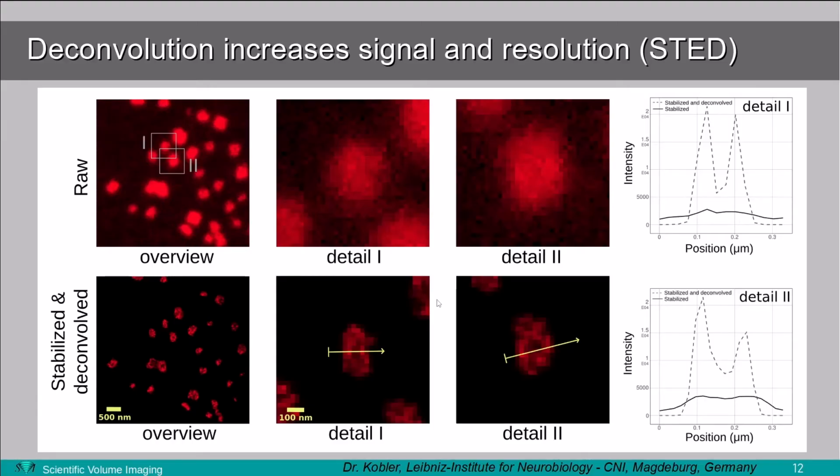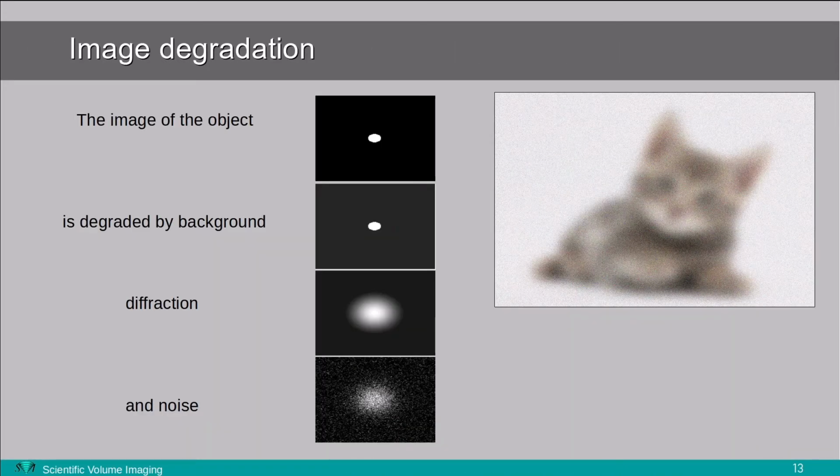Another example here is from neuromuscular junctions imaged. You see here the raw data and the deconvolved version. If we take two details of that, two zooms, and place them here, with the deconvolved versions at the bottom, making line profiles through that, then we see the intensity plots. The intensity increased more than 8 times, and the resolution also increased more than 1.5 to 2 times. So by having such a high signal gain, we have much more flexibility in setting the sides of this pyramid of frustration.